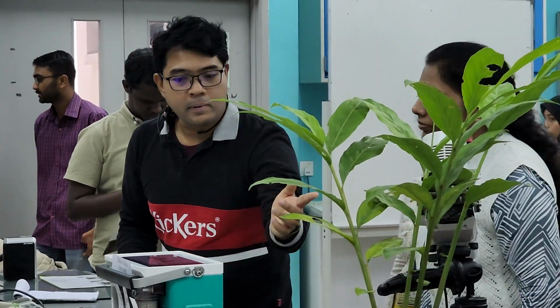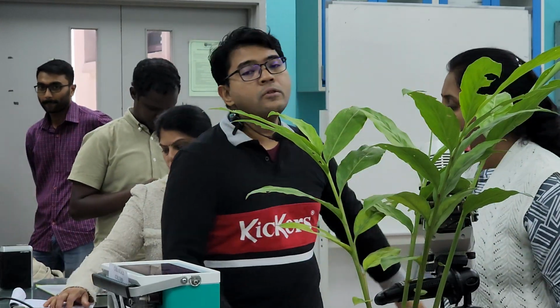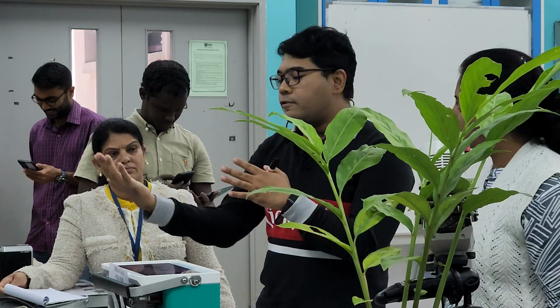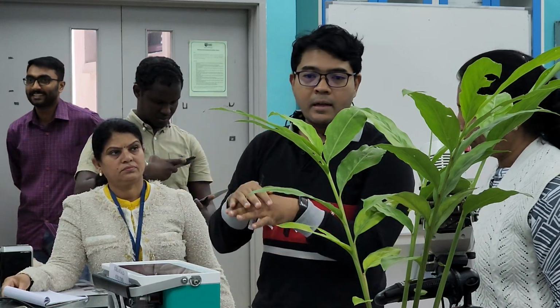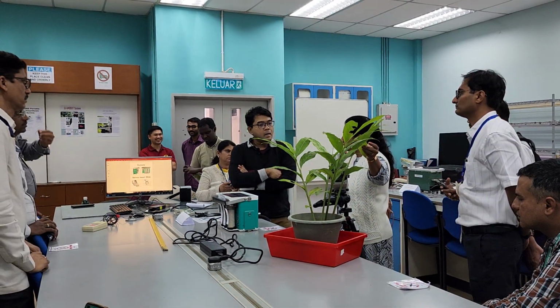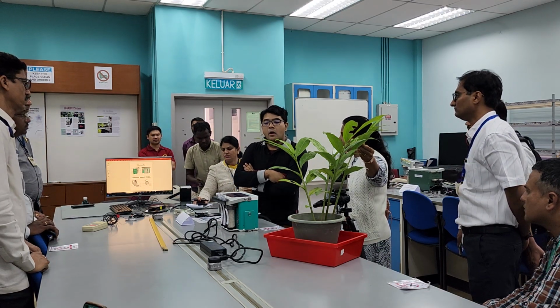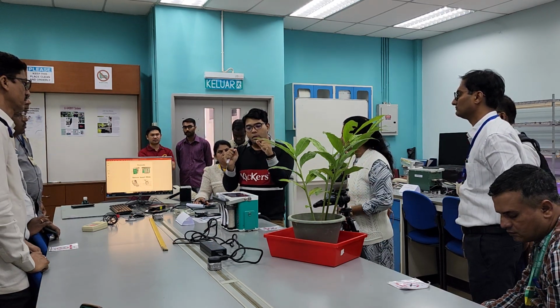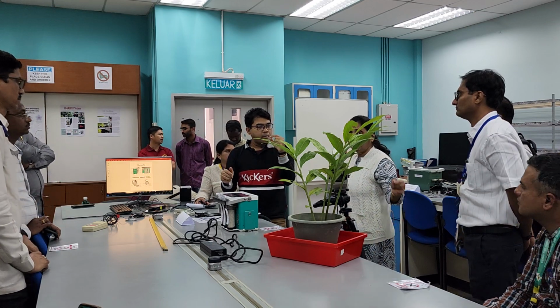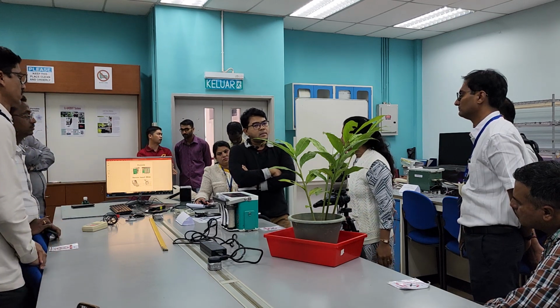For example, this plant is around 800, but if I measure that hibiscus there, the reading is not going to be the same, because the leaf structure and biochemistry have an impact on the fluorescence reading. If the thickness of leaves is more, is the reading high? Leaf thickness doesn't matter as long as it's flat.